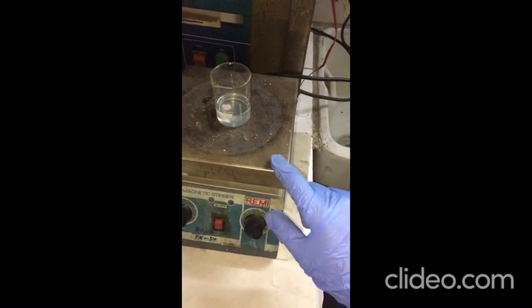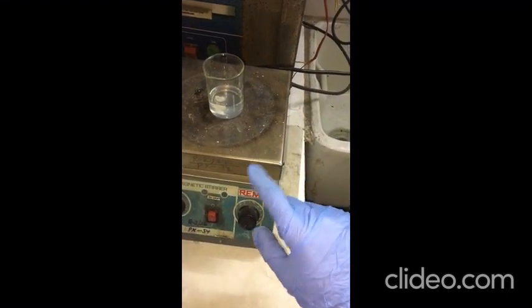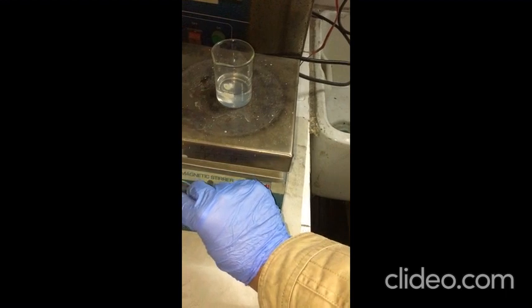This is also a heating switch. You can change the temperature of the heating plate by this knob.